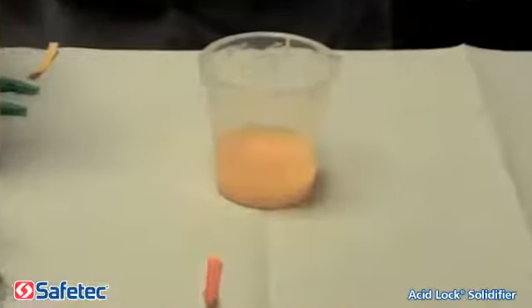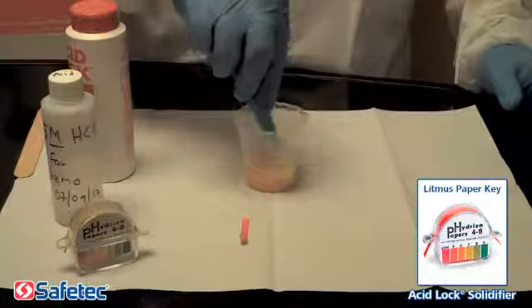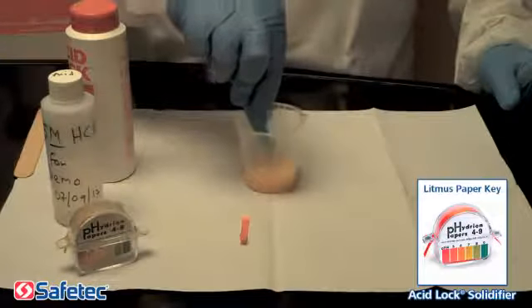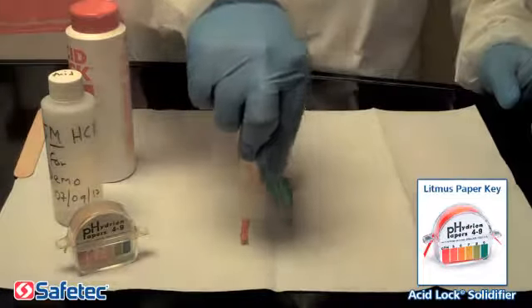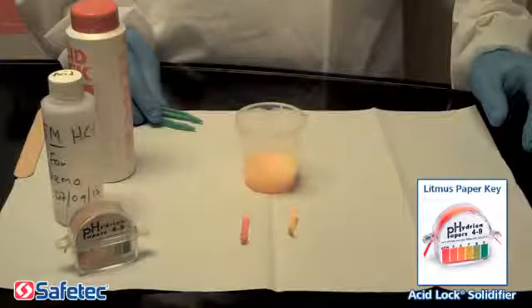Step 4. The fluid will then solidify and change color from pink to yellow when safely neutralized. Step 5. Finally, we will use our litmus paper again to test and show you the neutralized pH level of the fluid. You are now ready for cleanup. Remember to follow your facility removal and disposal guidelines.